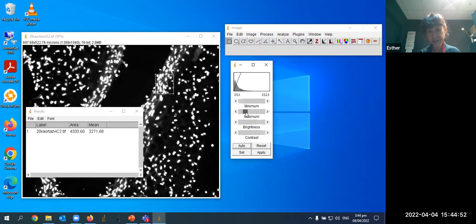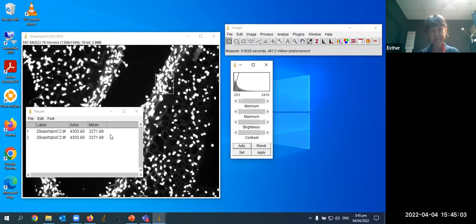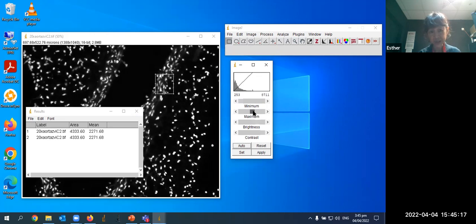If I change the value of the maximum display value and I measure it again, the mean intensity remains the same. So this shows you the actual intensity value of all the pixels in this image, even though it looks very bright, it's still the same. It just changes the display. Okay. And so the other question is, how do you present many images if you want to compare, say, whether one image is brighter than the other image? As you can see, when I adjust the maximum, I can make the image look brighter or darker, right? So if you want to show many images, you have to show the same adjustments.